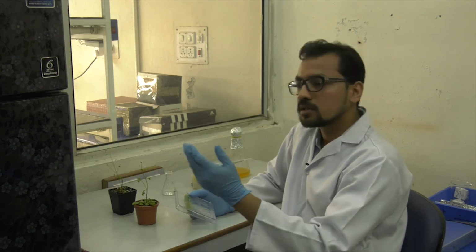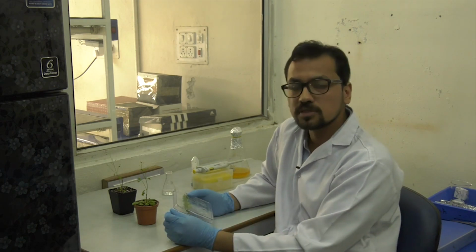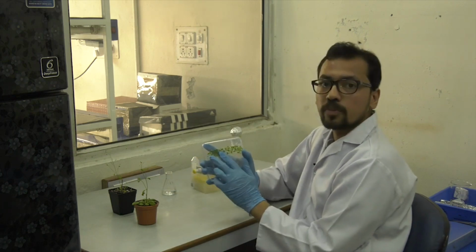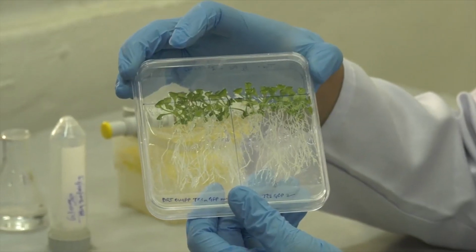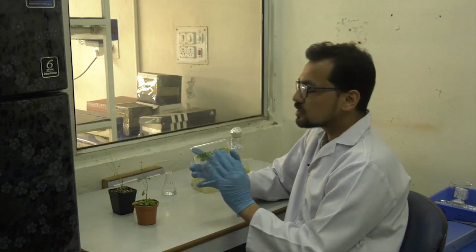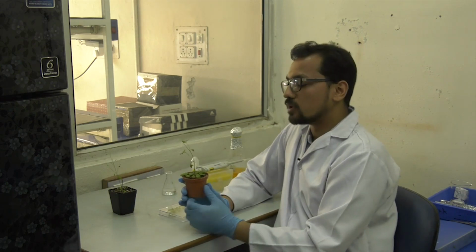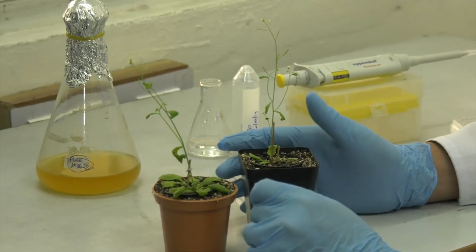Similar to the procedure in rice, we also surface sterilize the seeds of Arabidopsis, and these sterilized seeds are placed on the half MS plate. So this is the half MS plate where the seeds were put, and after about 2 weeks the plants are of this length. Now once my plant has enough root and a healthy shoot, this is transferred onto soilrite. Once on soilrite, this plant grows to this height in around 1 month, and this is my fully grown plant, which you can see here.